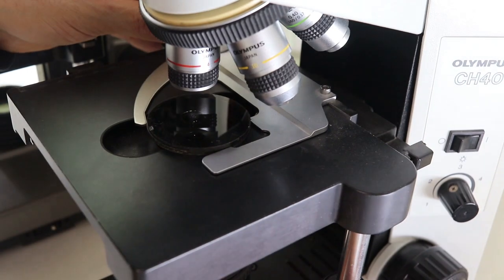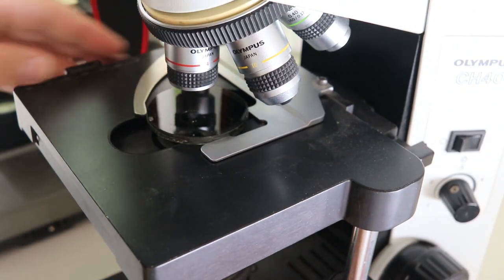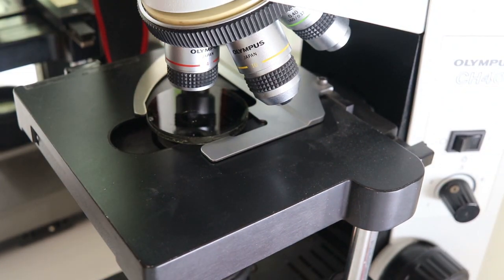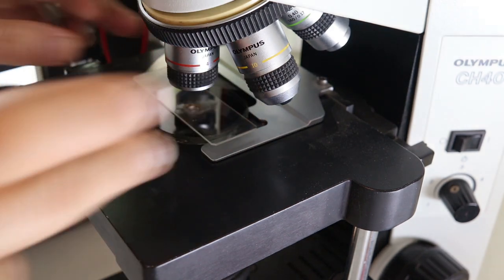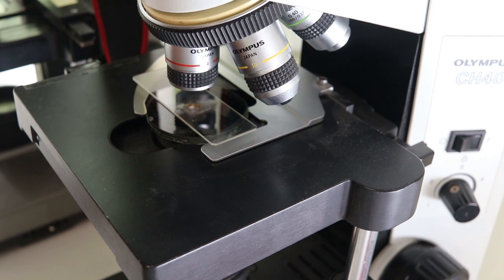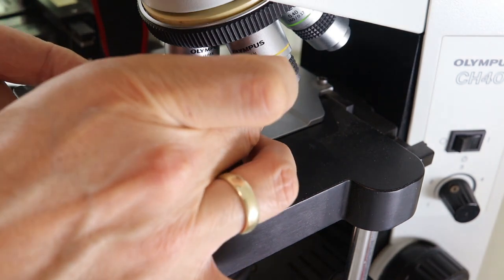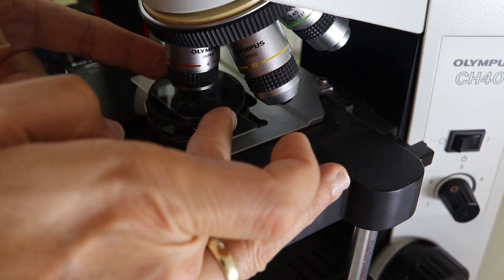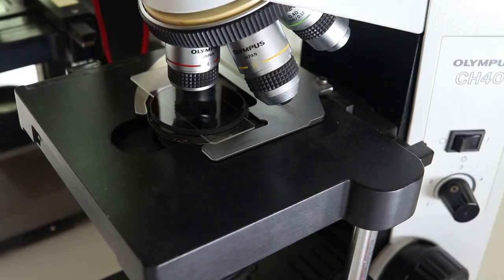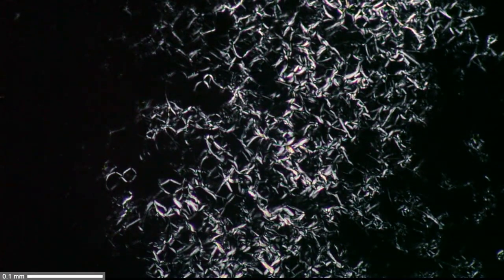Yeah, the first filter is referred to as the polarizer and on top of the polarizer, you place the specimen slide and then the analyzer. They have different names, but actually both filters are the same. Okay, so it's simply that their use gives it the name. I have to turn them properly and that's what I see.